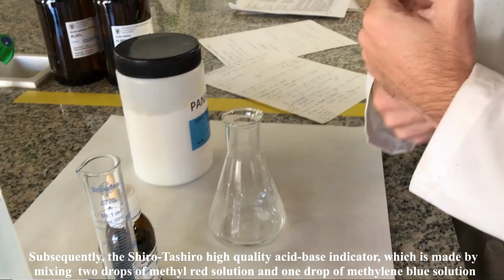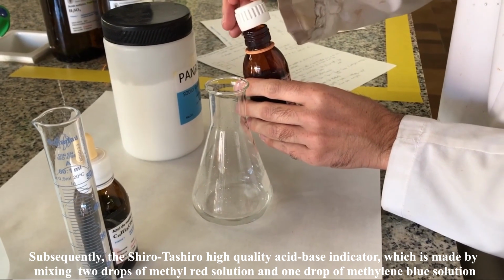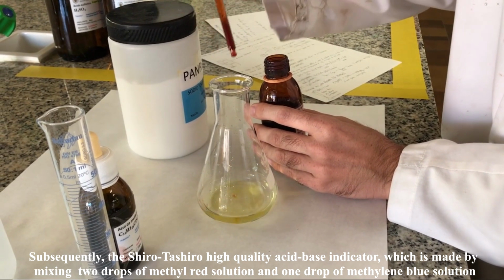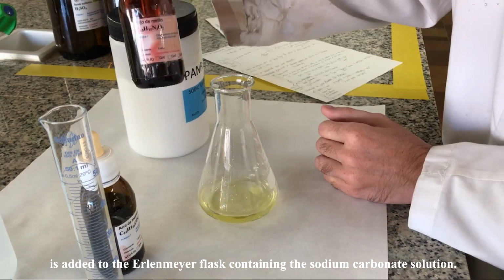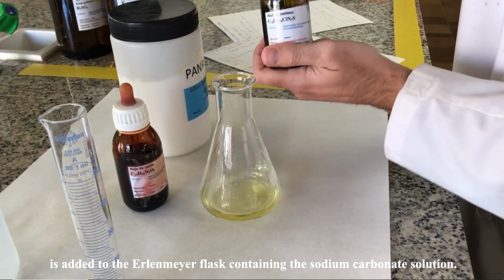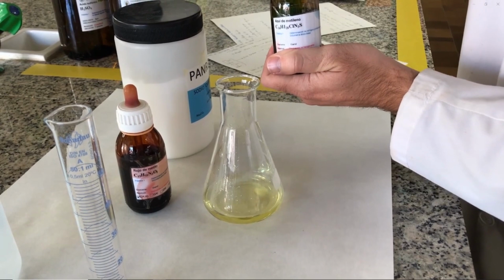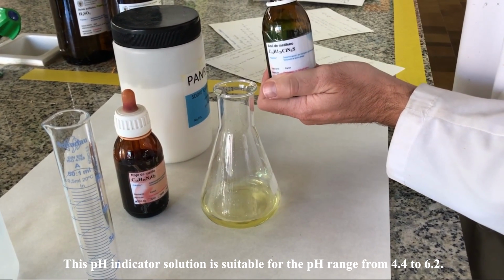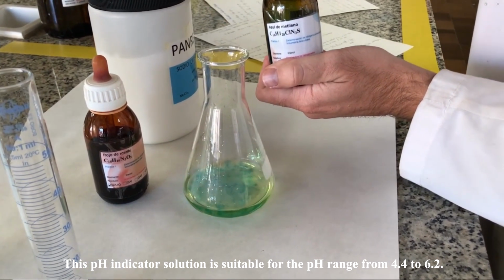Subsequently, the Tashiro high-quality acid-base indicator, which is made by mixing 2 drops of methyl red solution and 1 drop of methylene blue solution, is added to the Erlenmeyer flask containing the sodium carbonate solution. This pH indicator solution is suitable for the pH range from 4.4 to 6.2.